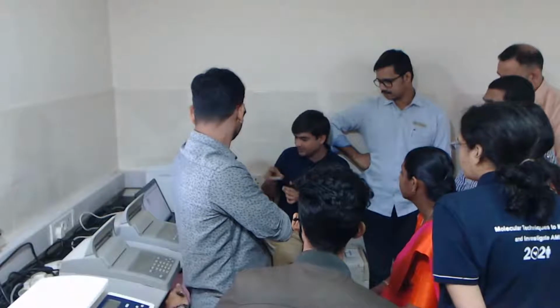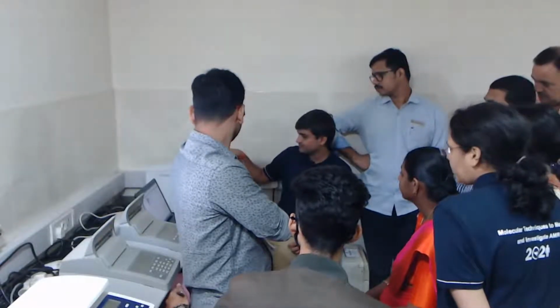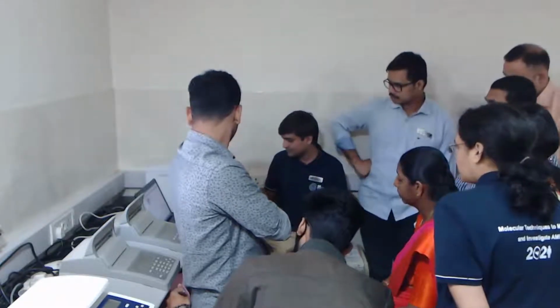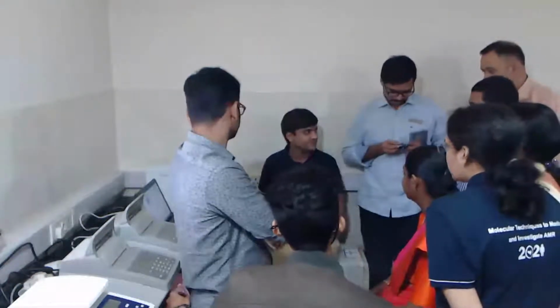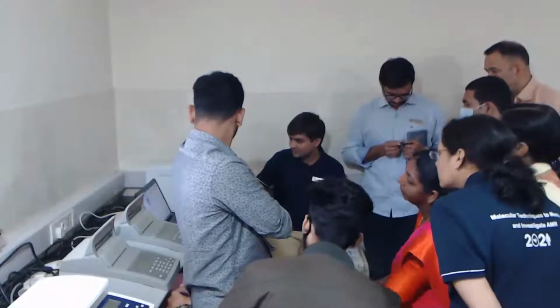So we'll again keep the chip with water for wash. And this is again a used chip to be thrown away. Coming to the results.